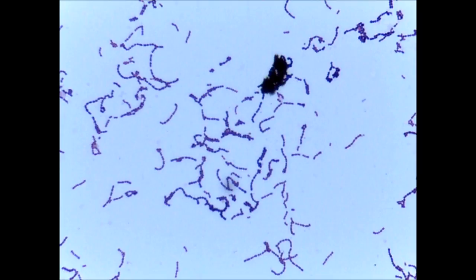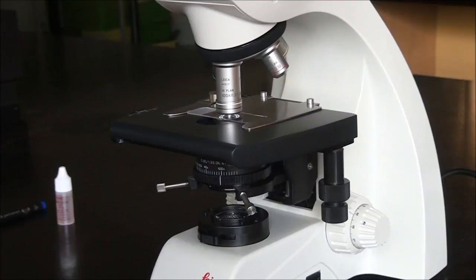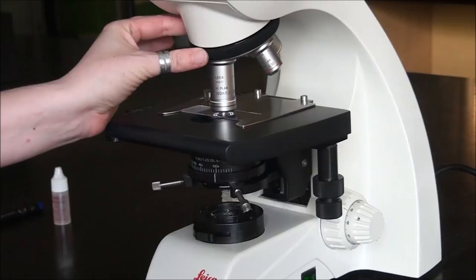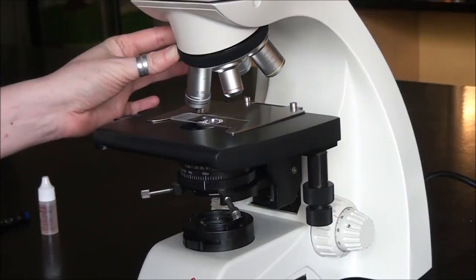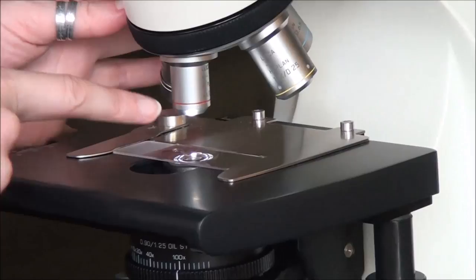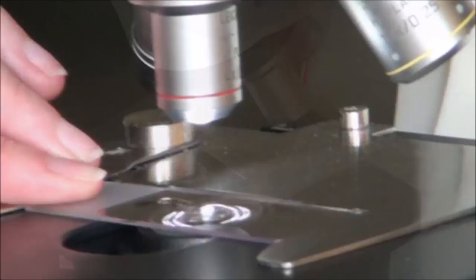Once you're finished with your microscope slide, we need to get rid of the slide and take care of the microscope. First thing we're going to do is move the turret so that we move away from the 40 and the 100. We're going to turn the turret so that we have the 4x lens in place because there's no risk that it's going to touch the oil. We're going to take our slide out of the tray.